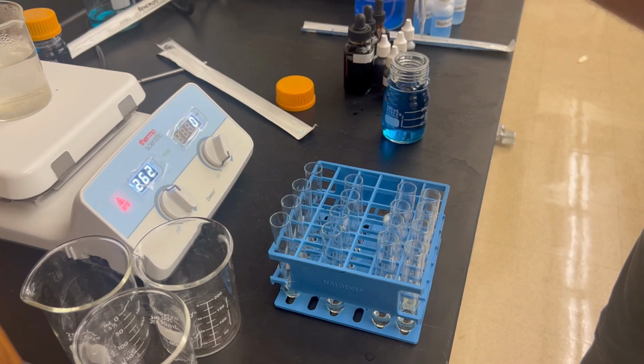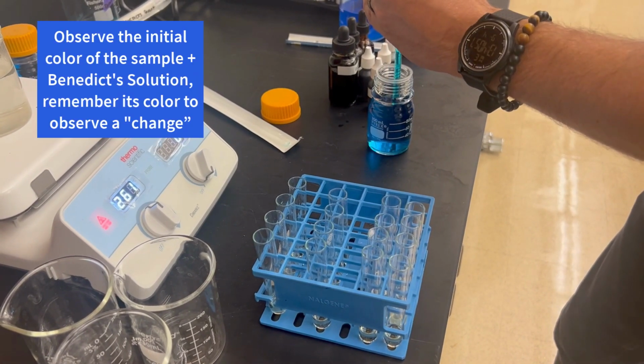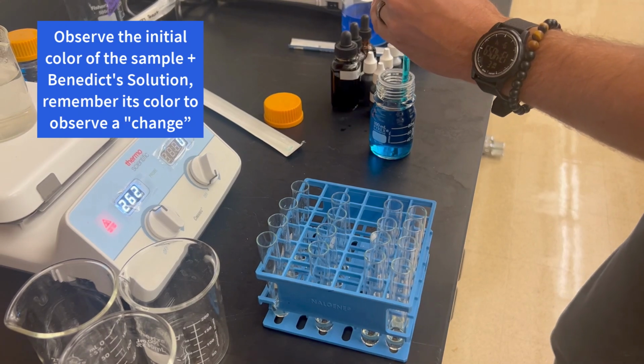Taking our Benedict solution, we're going to put 2 mLs in each one of these.